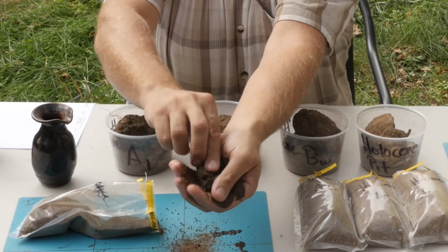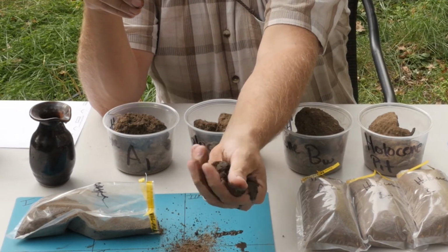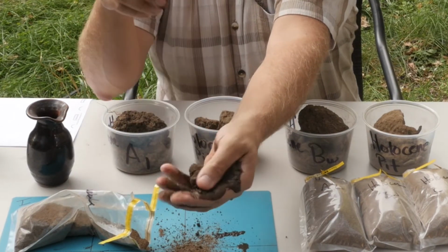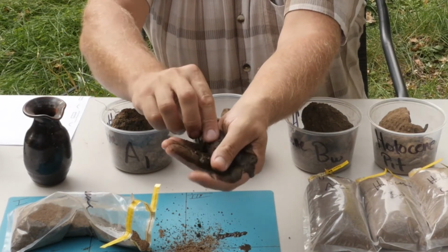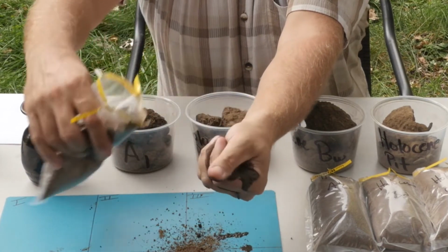Just like baking cookies, right? You want to get the right consistency. You don't want it too juicy, and you definitely don't want it too dry. You want these particles to kind of adhere to each other and start to interact with each other. Part of that is related to the colloidal components or the finer fractions in here that we talked about these last weeks in the videos.